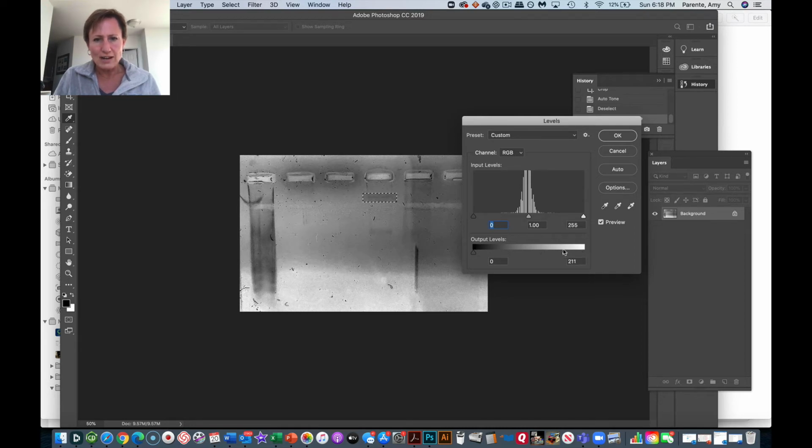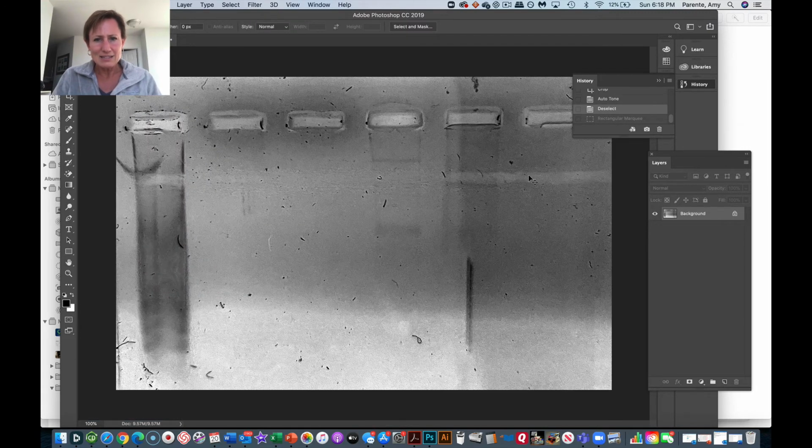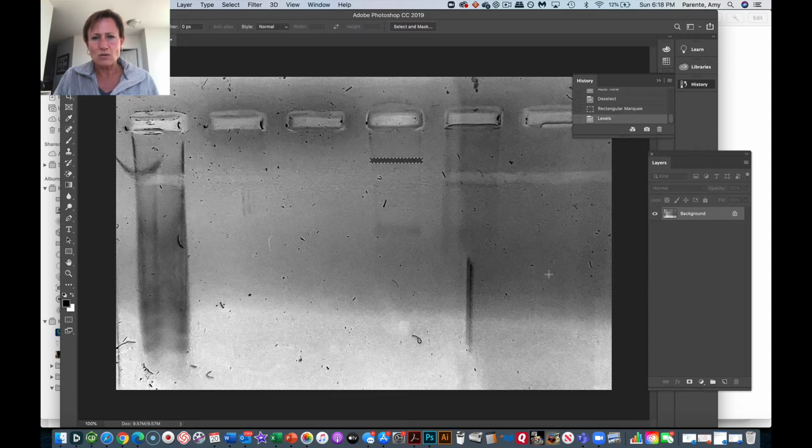So they'll go and toggle things here. Again, let me say, you know what? Let's go in and just highlight this band here. I want this band to look darker. So I'm going to highlight where that band is. And then I'm going to go to my levels again, and I'm going to make that band look darker. Oh, doesn't that look so much better? Well, okay, that looks pretty fake right now, but it's crazy that you will see gels.